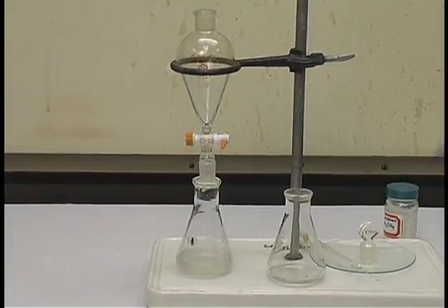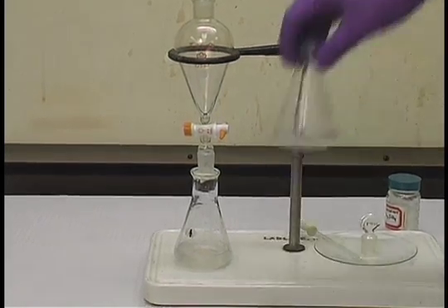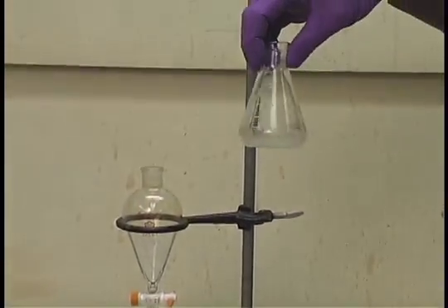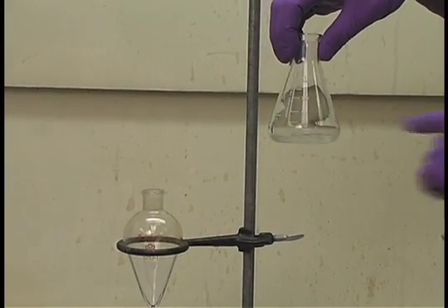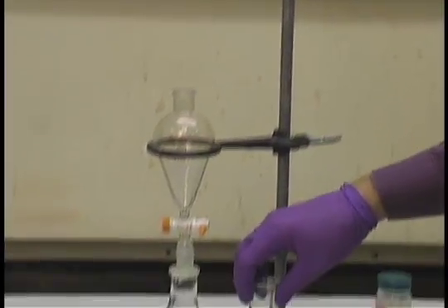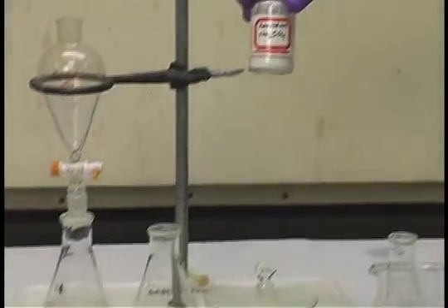If you need to repeat the process, place the solution back into the separatory funnel and repeat. In this particular case, I'm happy with the first extraction, and so now I have my solute in the separatory funnel, but I now need to dry this organic layer. It is wet with the water. This can be accomplished using anhydrous sodium sulfate.